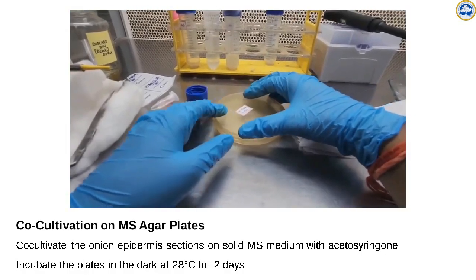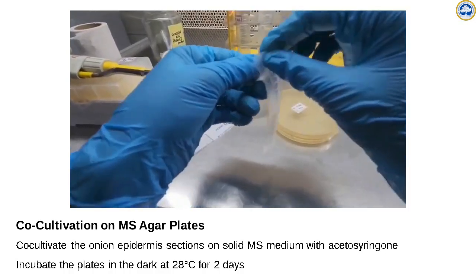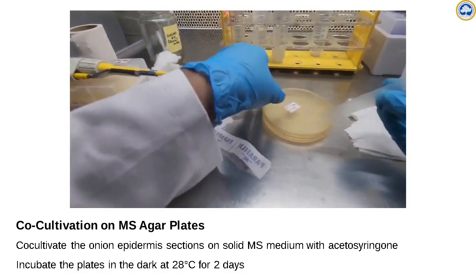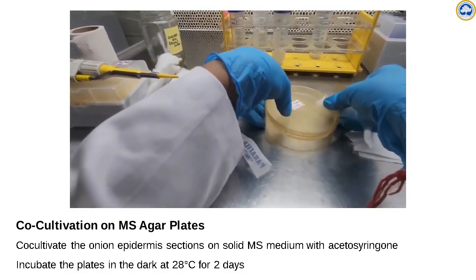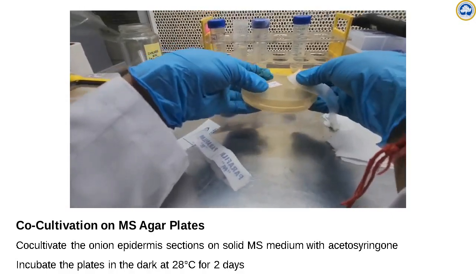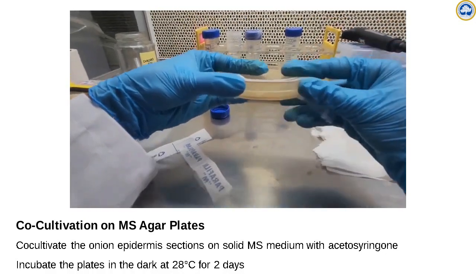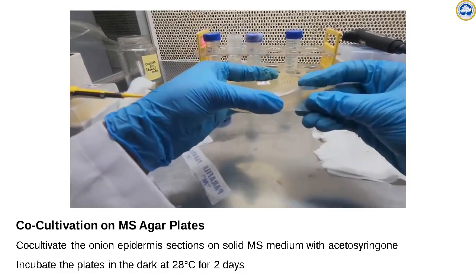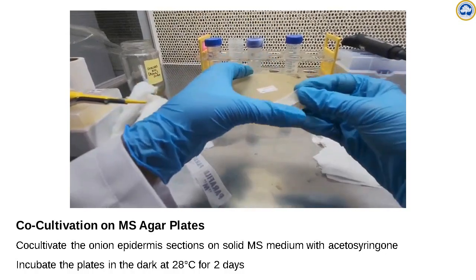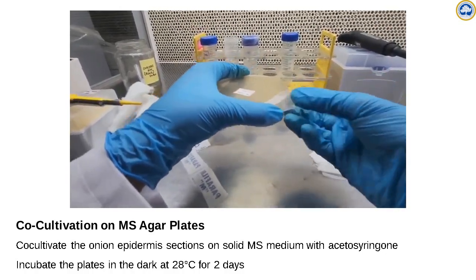Co-cultivation is the time when agrobacterium infects the plant cell, transfers the T-DNA and integrates it into the host chromosomal DNA. The co-cultivation time can be optimized based on the expression level that you see.